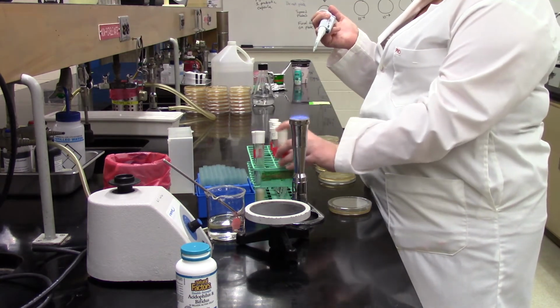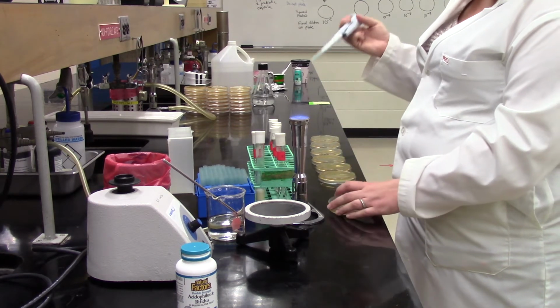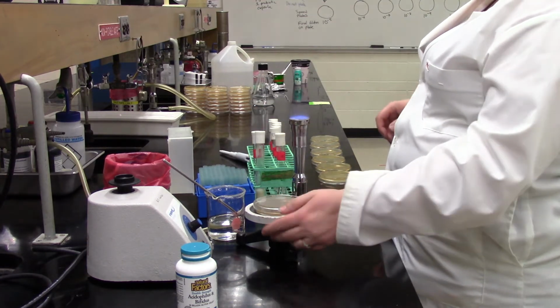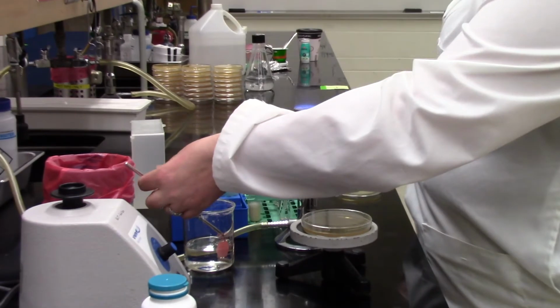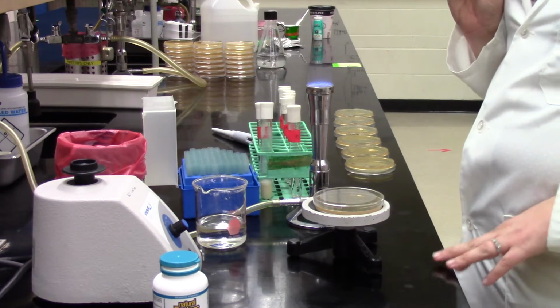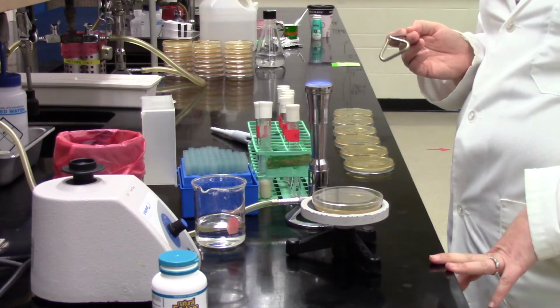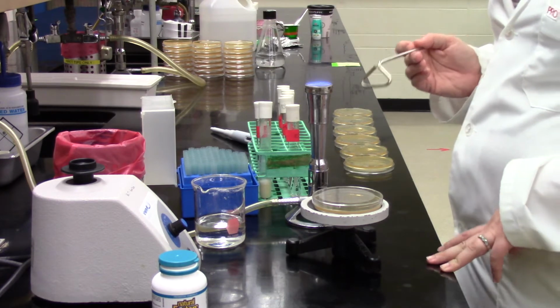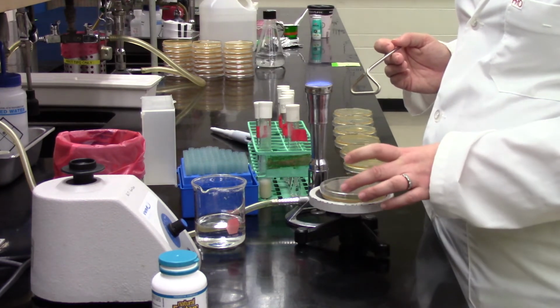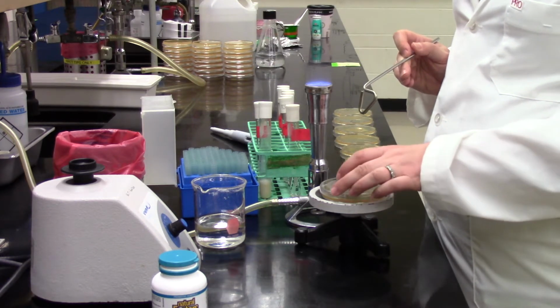So she's pipetting up 100 microliters. She heard the vortex, saw the vortex go, so we vortex that sample, and 100 microliters goes onto that plate. At this point, she's putting it on the little turntable. You don't have to use it, but it's a handy way to start doing your spread. She has taken a spreader, the metal spreader, from a beaker of 70% ethanol, which keeps it nice and clean, and she's flamed off that ethanol. Obviously, if we didn't flame off that ethanol, we would have a problem because bacteria do not like 70% ethanol and they would all die.